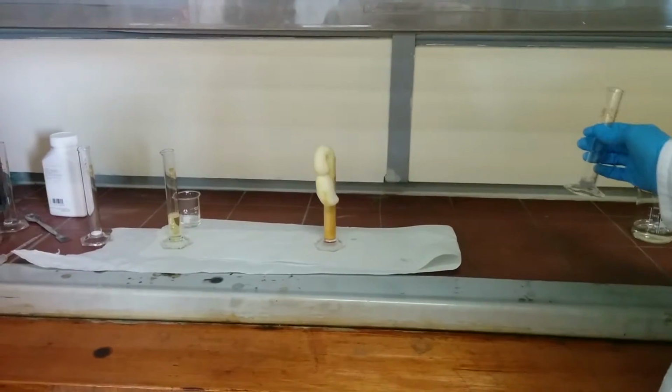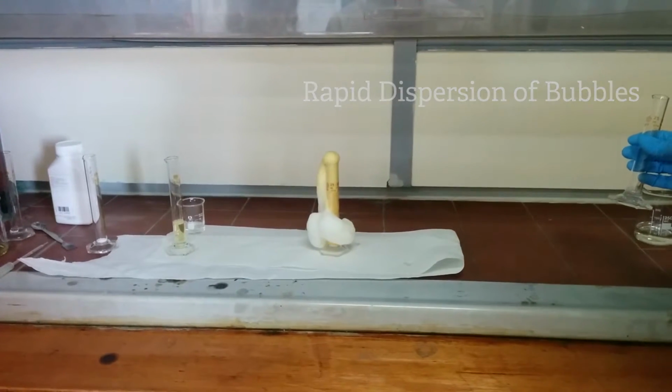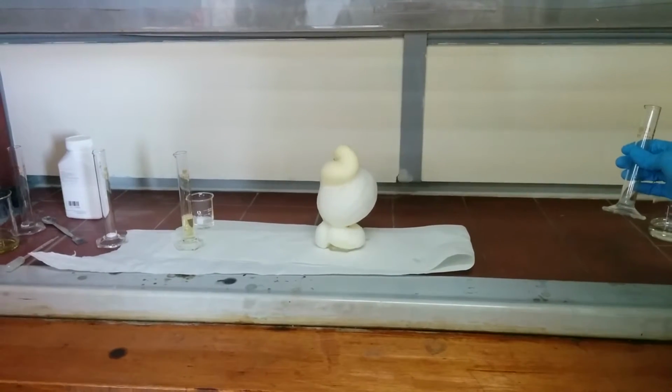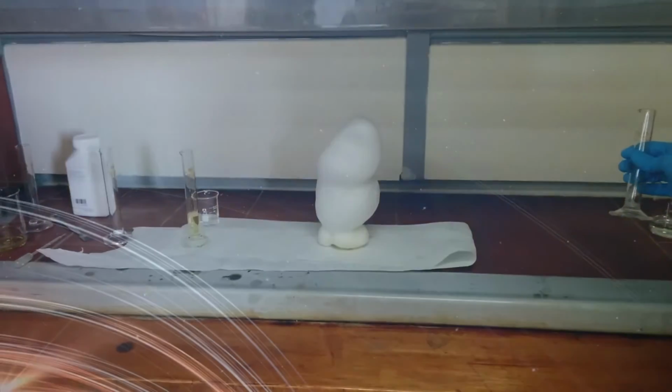A larger surface area is much better as the catalyst is able to react with more substrate to create a more intense reaction, as all the other crystals can react with the hydrogen peroxide in a shorter amount of time, making for a reaction which is faster and greater in severity, as shown in the video comparison.